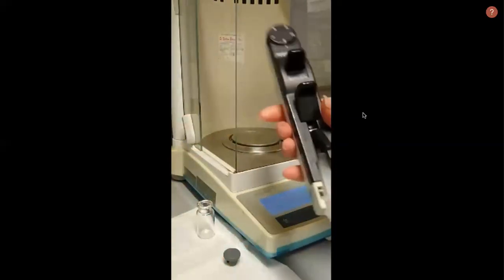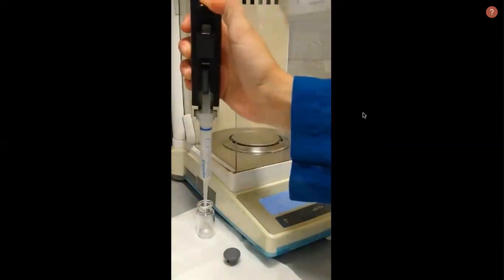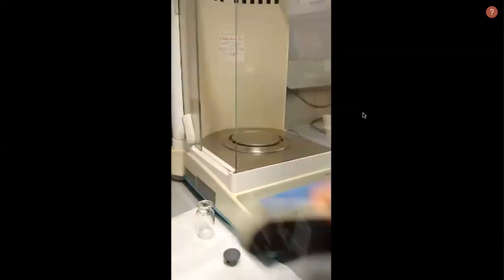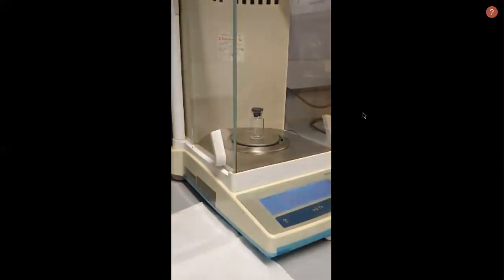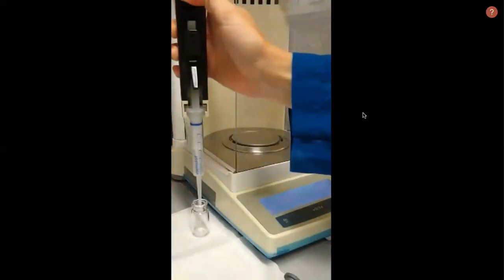In this case, we're using a 5 ml tip set to 2 in order to dispense 0.2 milliliters. The bottle is capped again and the mass should be recorded. That procedure is then repeated multiple times in order to find the average mass of this dispense. That is the mass of each spike of the fluoride standard used in the standard addition method previously.